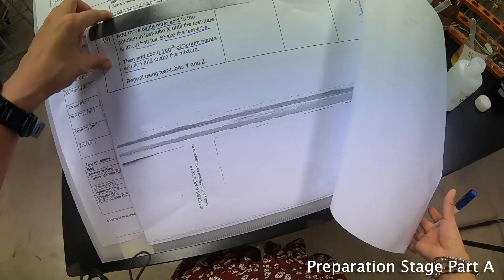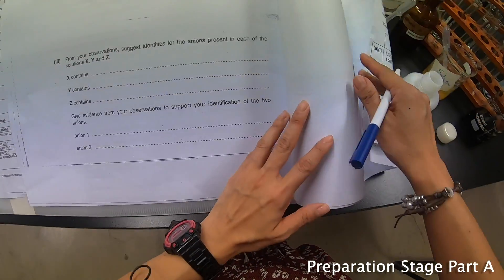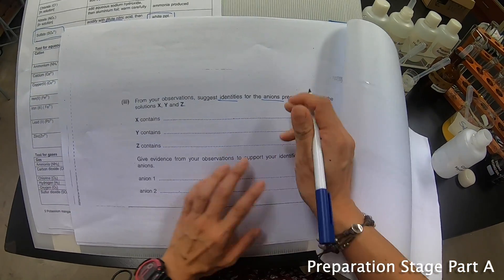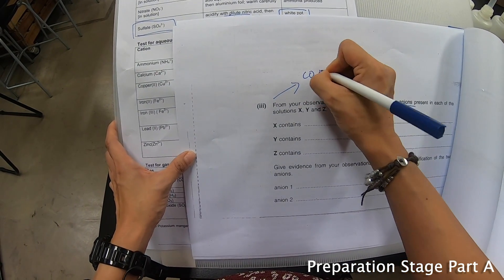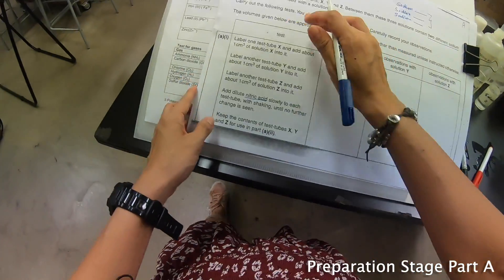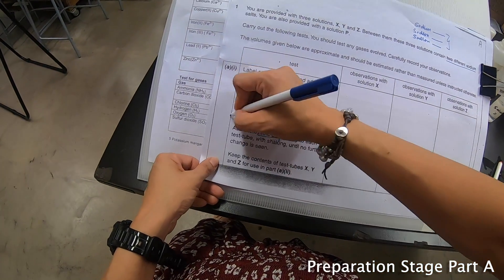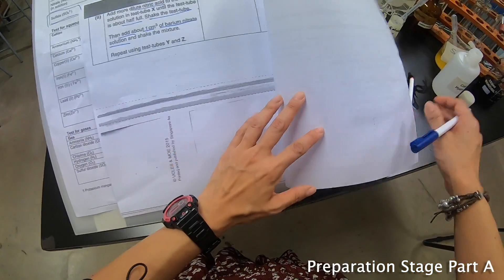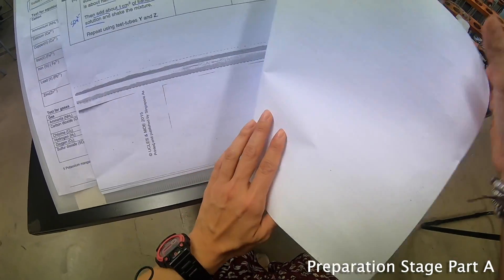I have prepared test tubes X, Y, and Z already. The question then says: from your observations, suggest the identity of the anion present in each of solutions X, Y, and Z. We already know we are looking for carbonate and sulfate. So I write 'carbonate' next to the acid step to remind myself I'm looking for carbonate, and 'sulfate' next to the barium nitrate step.